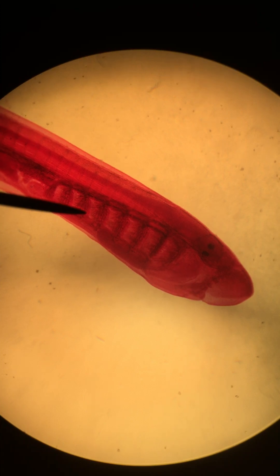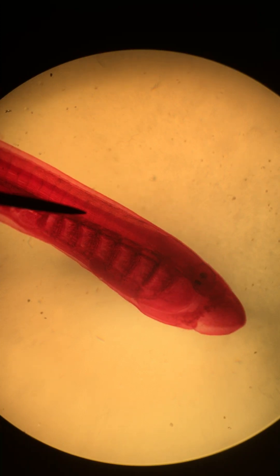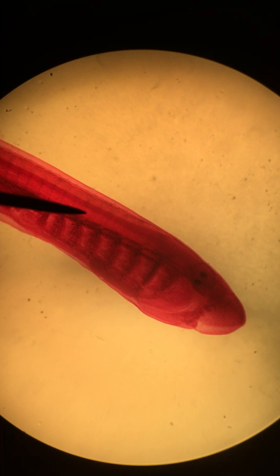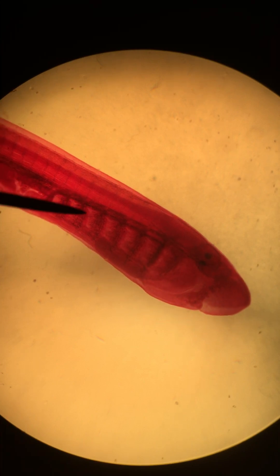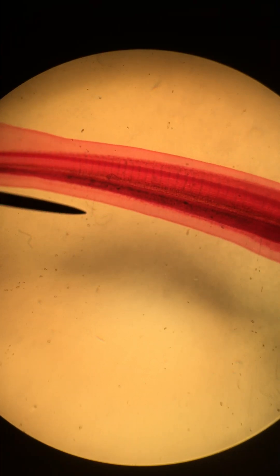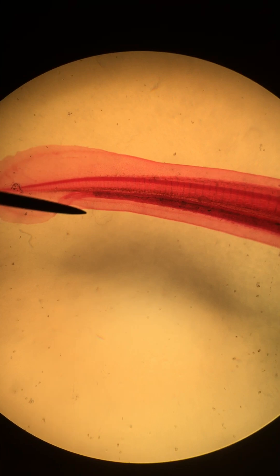Those are the dorsal nerve cord, the notochord, the pharyngeal slits, and a post-anal tail.